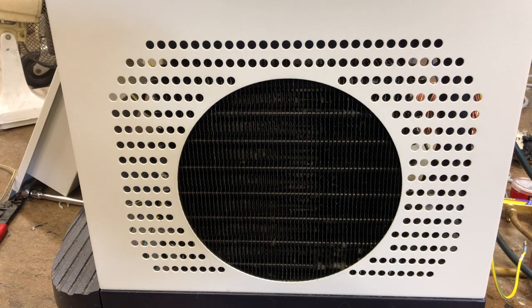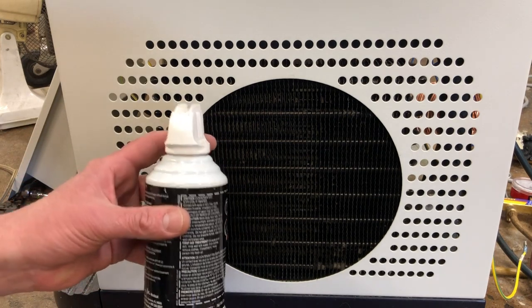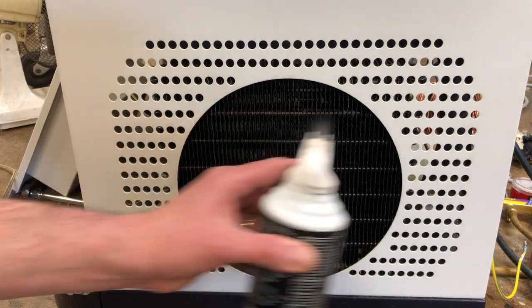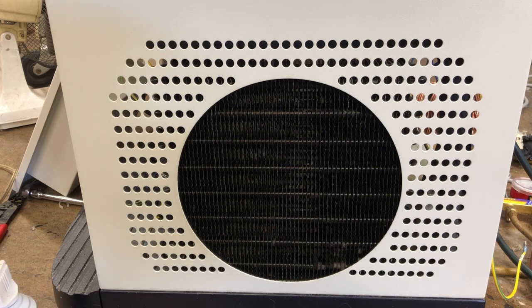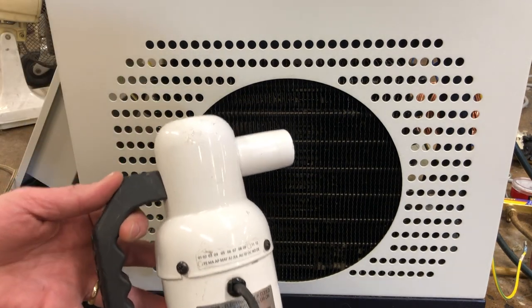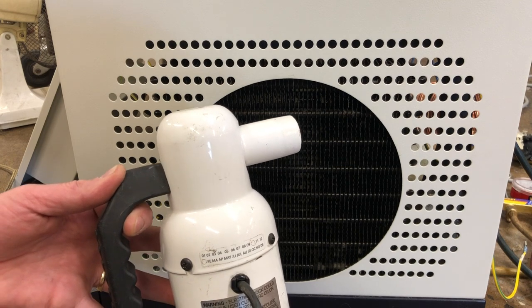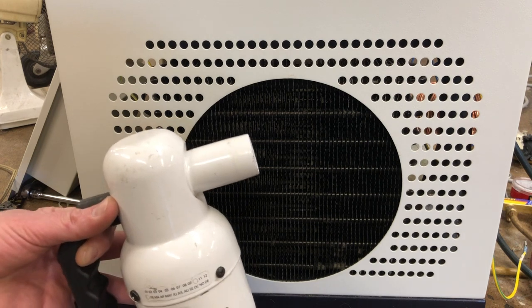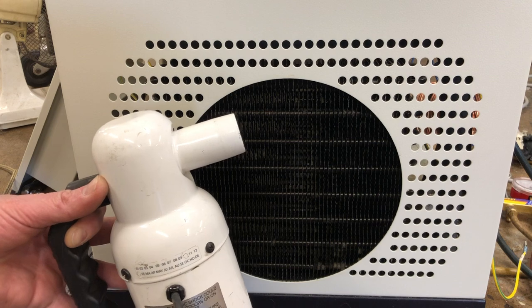Another good way to remove the dust is to use compressed air. This is a canned air from the office supply store — just spray it through and it forces the dust out of the coils. There's also an electric version I got online; it actually does a better job than the canned air. The big downside to using compressed air is that it really blows up the dust and can make a real mess in your lab.